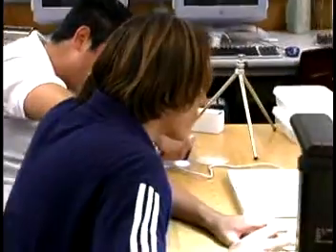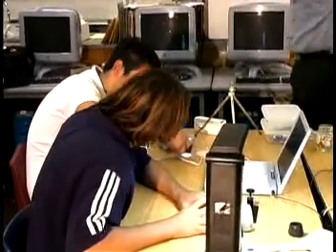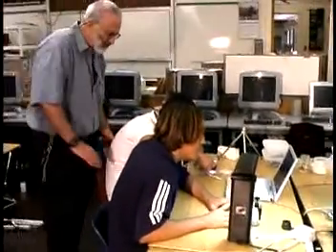The sediment lab is a fairly lengthy lab. The kids have to realize what sediments are, what minerals are, in order to describe their sediment samples. Part of sediment, and not on every beach by any means, are biological material too. The pieces of shell, the pieces of crab, a fish scale, a fish tooth, a piece of dried up algae, whatever happens to get washed up with the last wave is going to be part of that sediment. That tells me about what lives off of that beach, and that's an extremely important part of that sediment also.